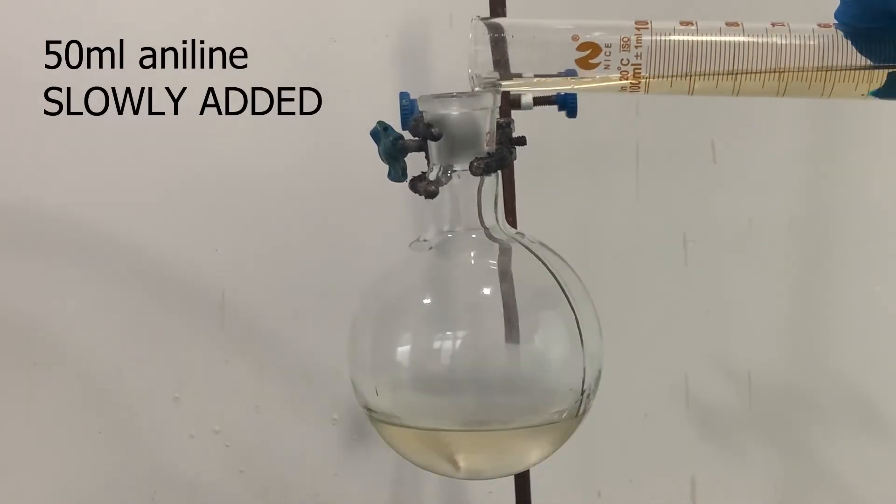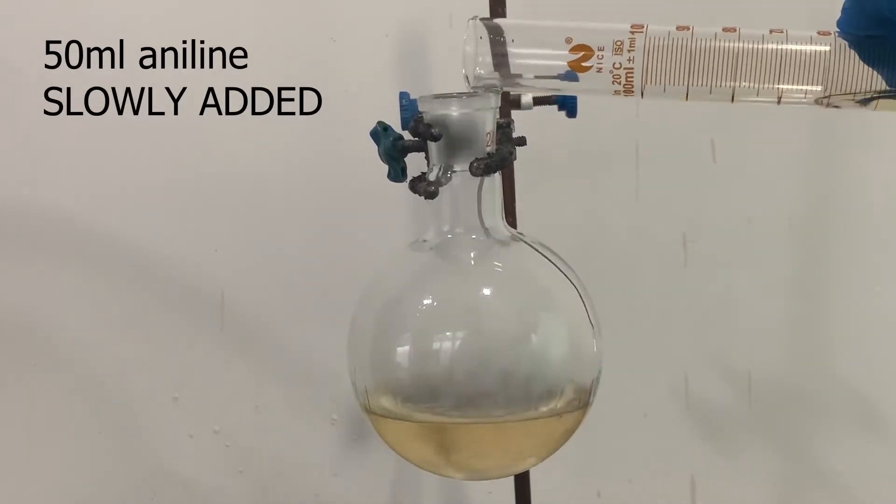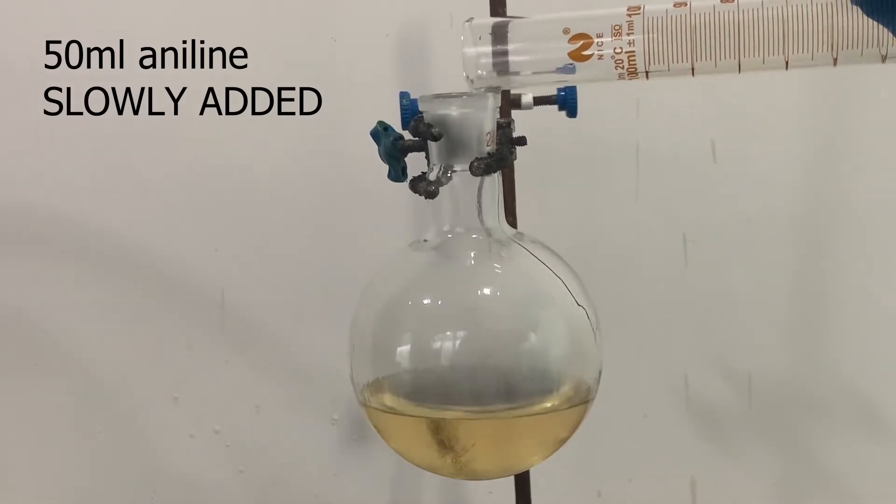50 ml of aniline is then slowly added to the mixture. This is very exothermic.